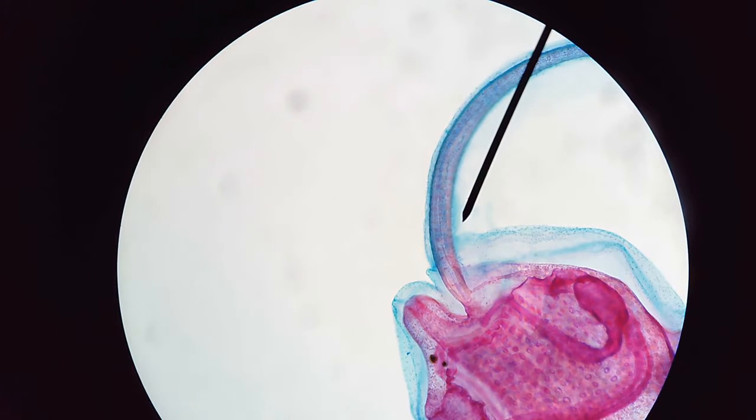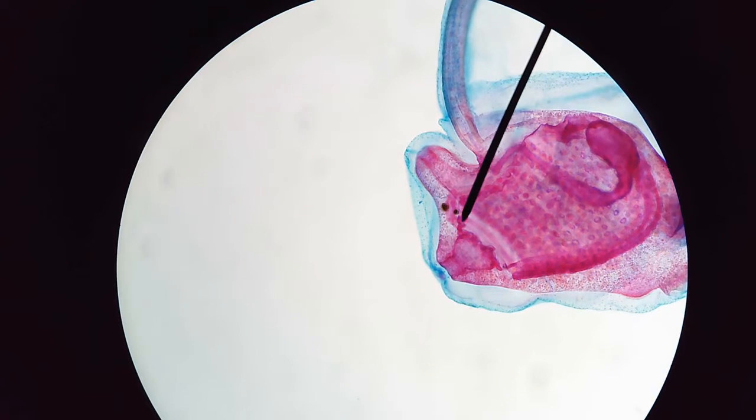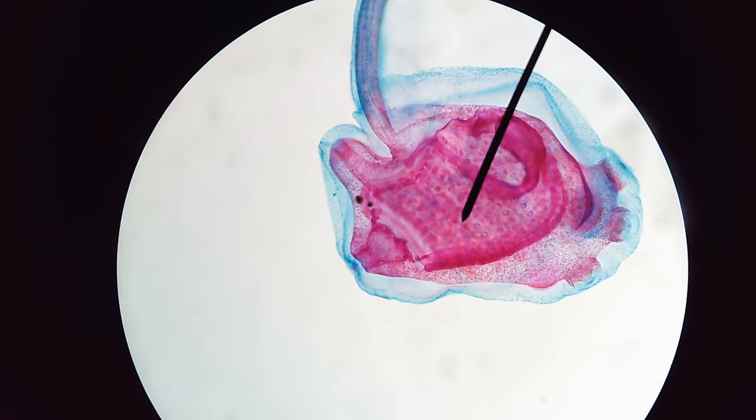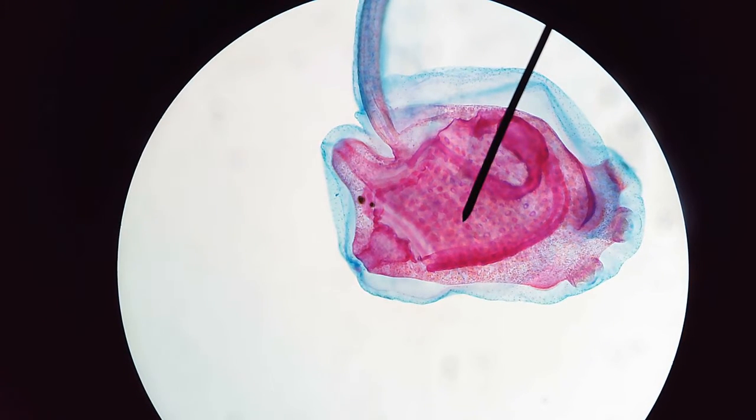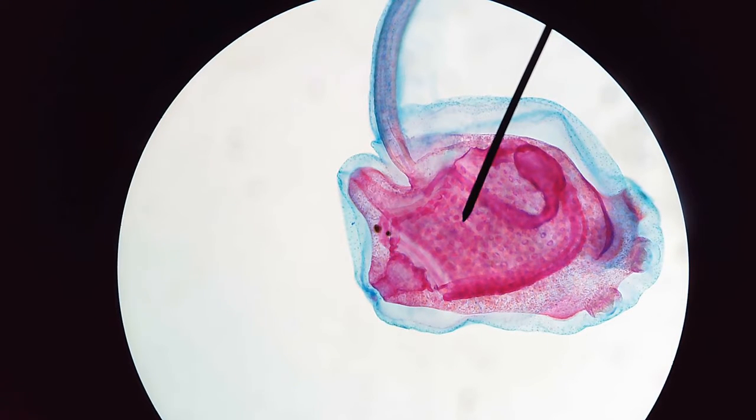Going further down into the guts of the organism, you'll notice all these dot-looking structures scattered throughout the body. That is going to be the organism's pharynx, obviously derived from the pharyngeal slits, one of the 5 derived characteristics of chordates.